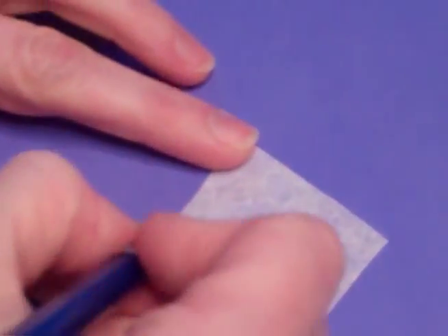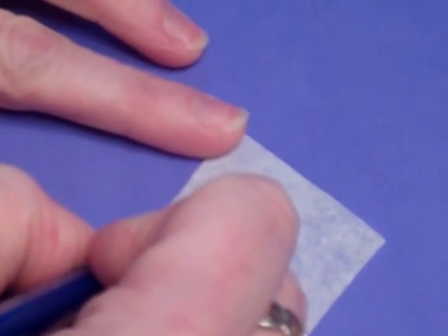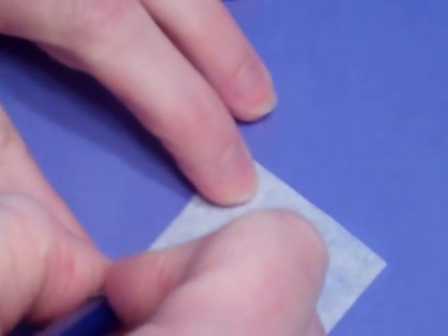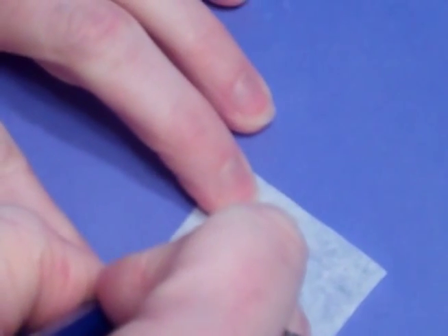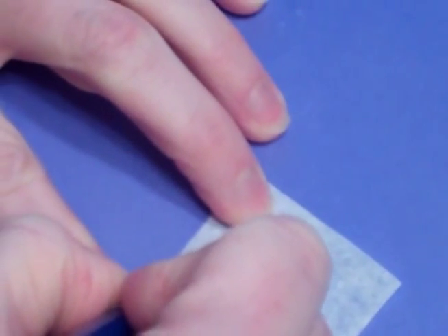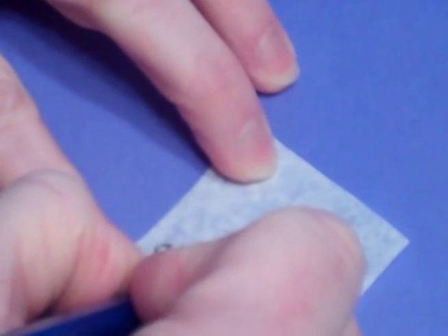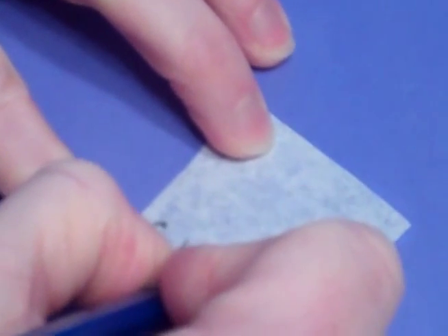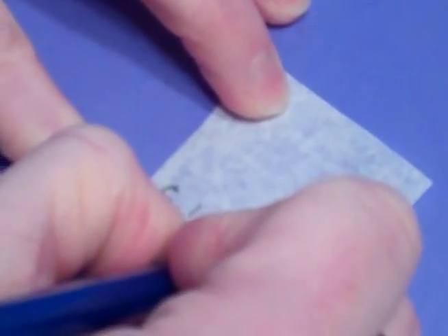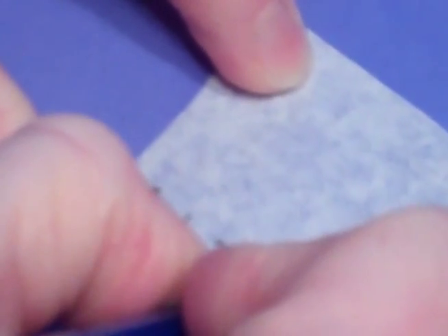Approximately three-quarters of an inch from the bottom using a pencil, label C for the criminal, and 1, 2, 3, 4, and 5 for each of the suspects.